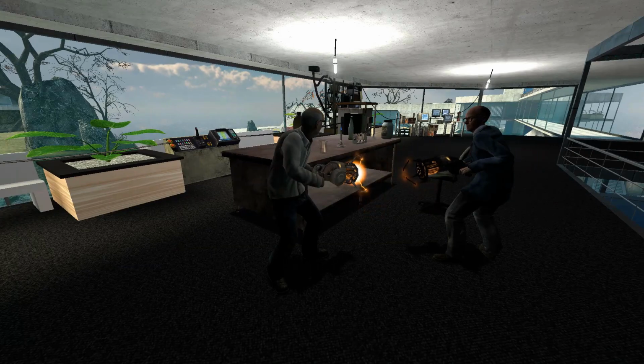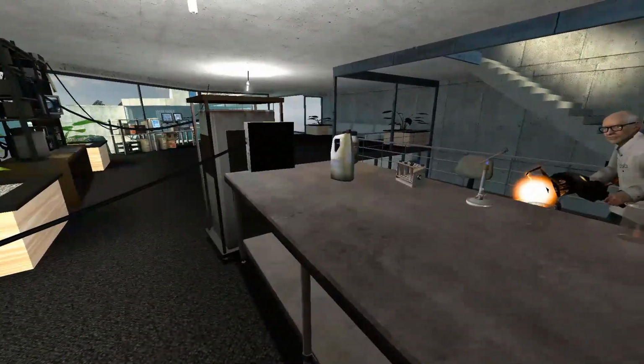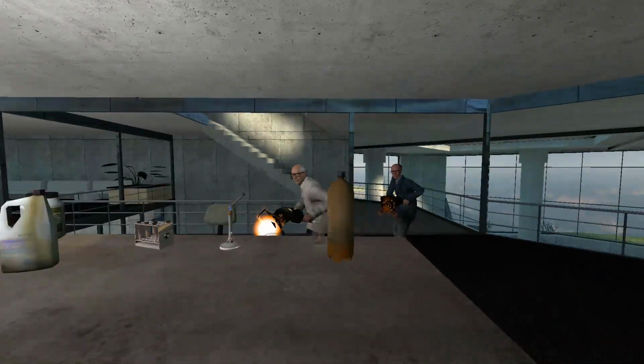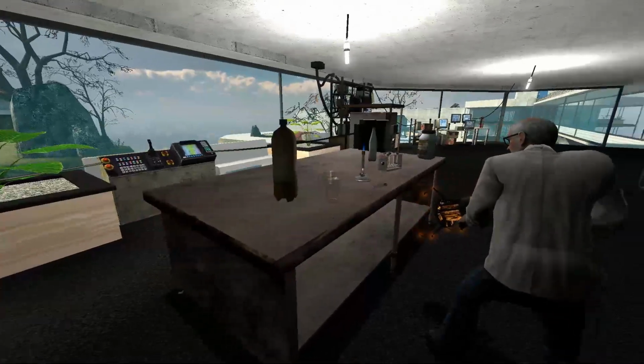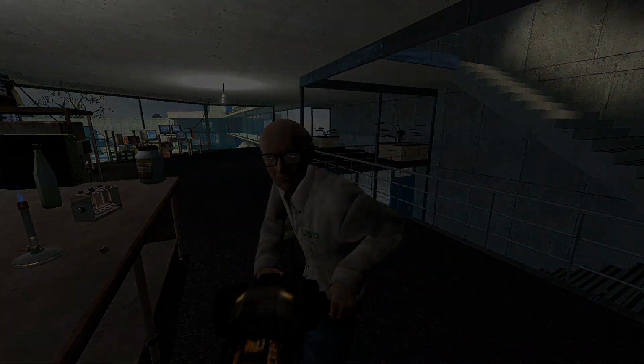Alright, come here, Gabe. I'm gonna carefully give it to you. Alright, now carefully put it over the fire and heat it up. Okay. See? Perfect. Now just heat that up, and you gotta be very careful with this. Oh no. Gabe. That's not how you handle hot substances.